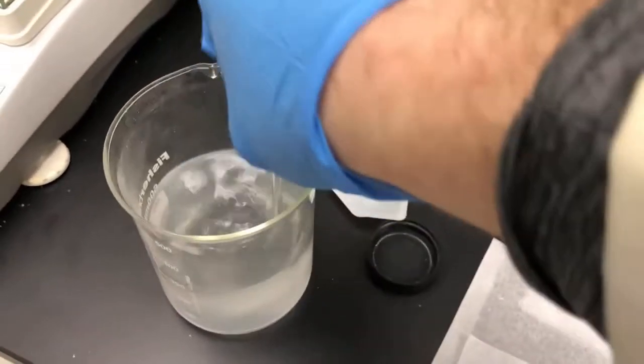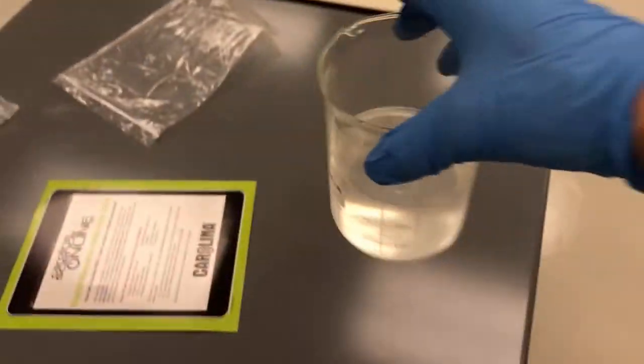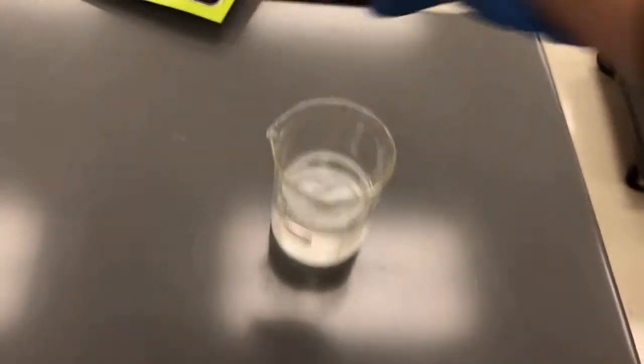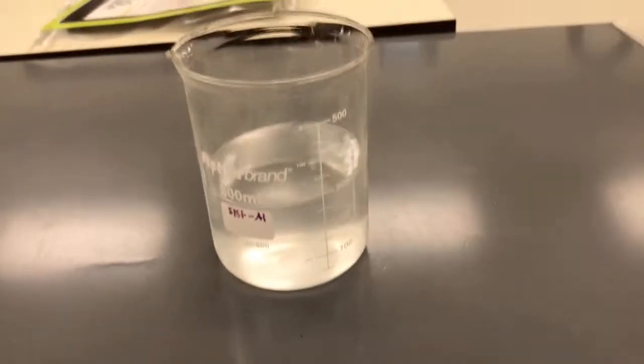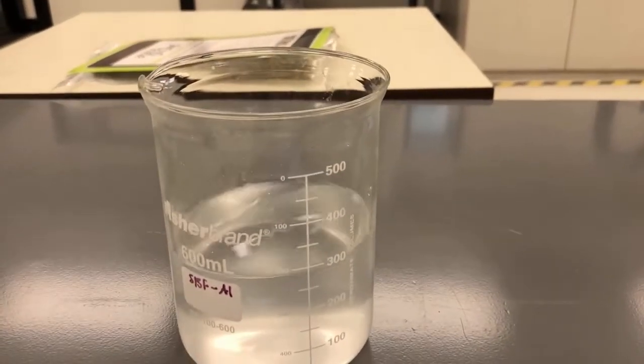Now we're going to run the experiment and create a galvanic cell. We've been working previously with standard temperature and pressure protocols, so you can use the table we've introduced in our notes to calculate the cell potential. But now we're actually going to create that cell ourselves.